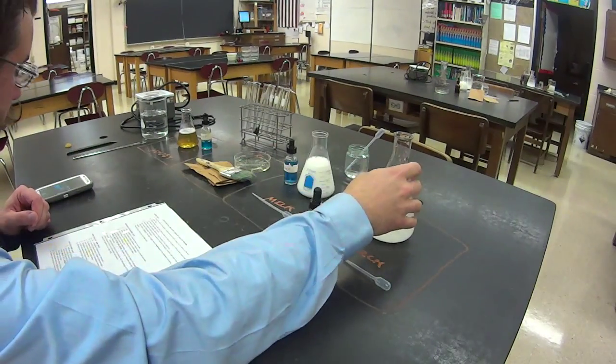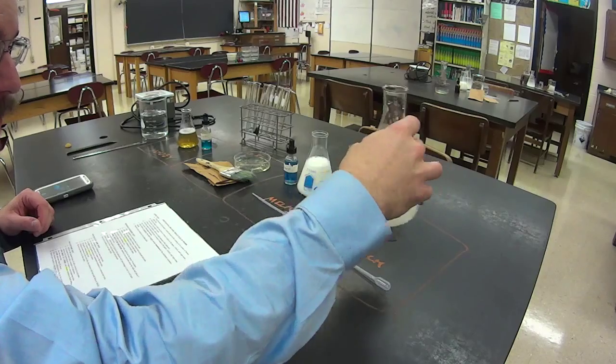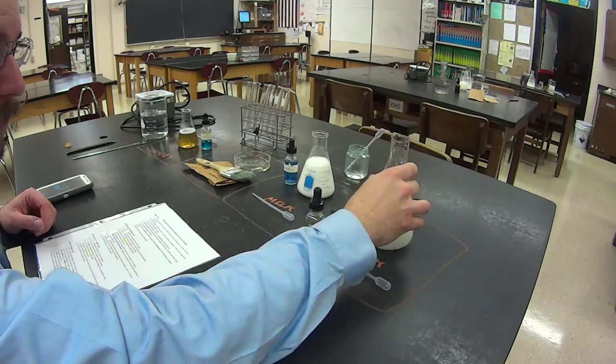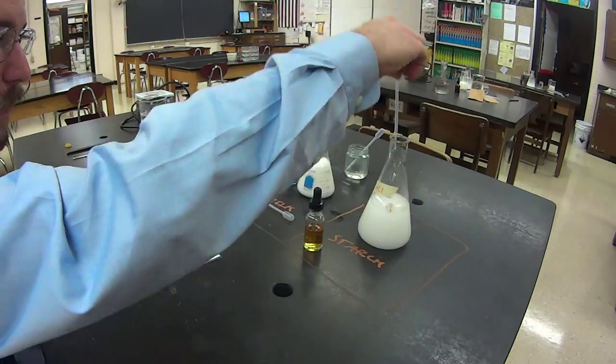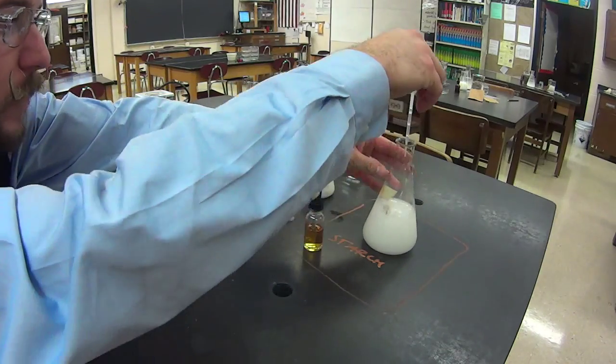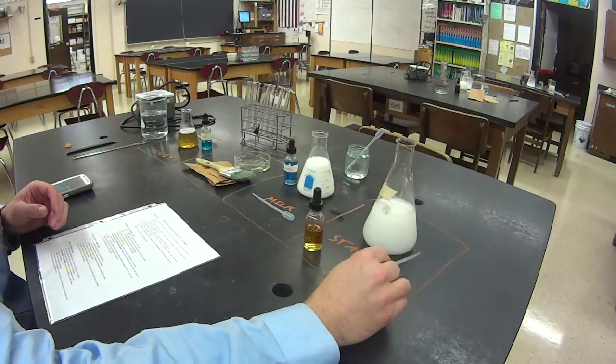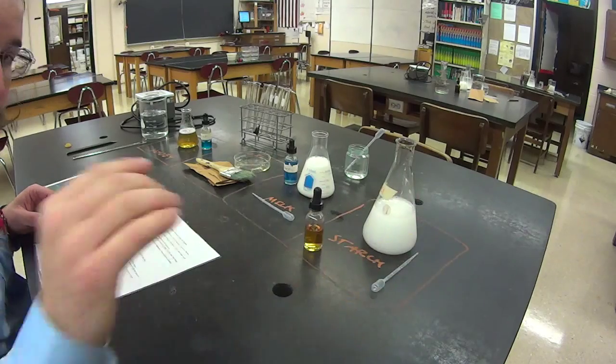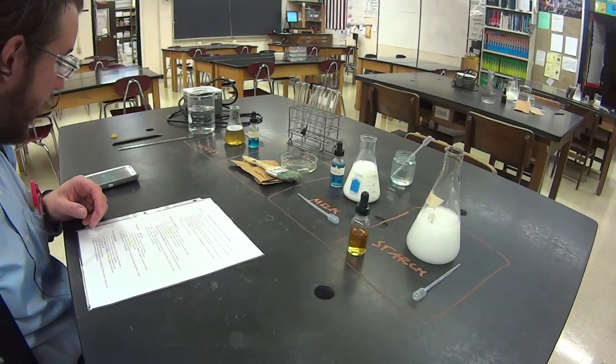Starch. Nice polysaccharide. You may have to spin it up a little bit. Use the pipette. Stick it down in there. You may have to turn this a little bit. You're just going to be doing a few drops. Sometimes it'll talk about a pipette load. Then you'll just use a pipette load as instructed.